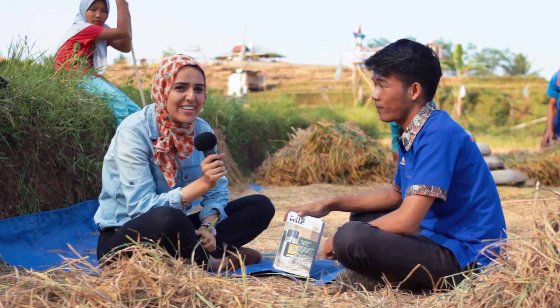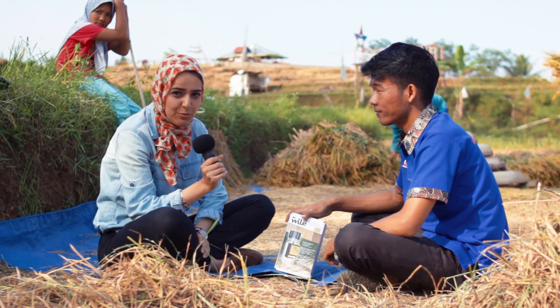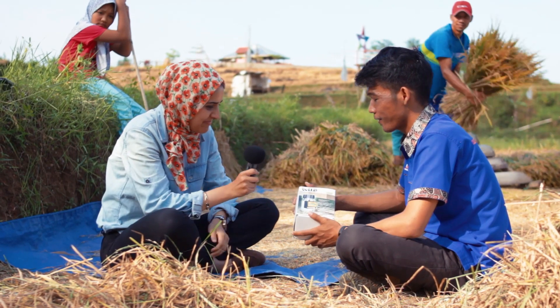Welcome back, sahabat. So right now we're going to get started and test the Wild 55 moisture meter. Alright, Mamuri, you want to take a lead? Okay.